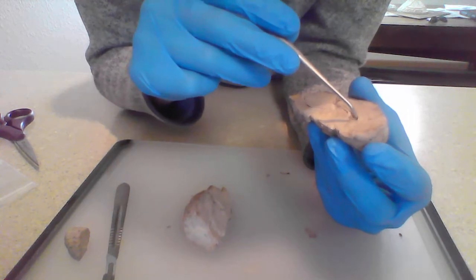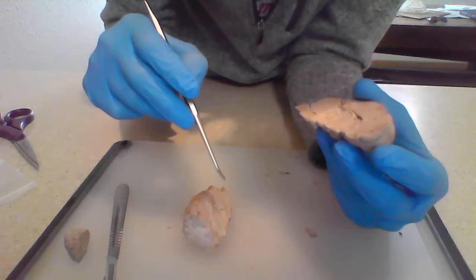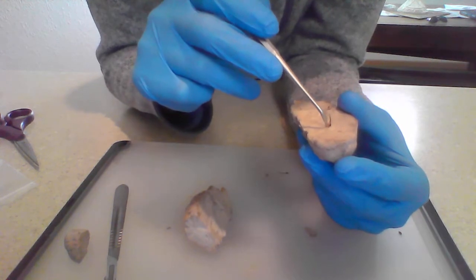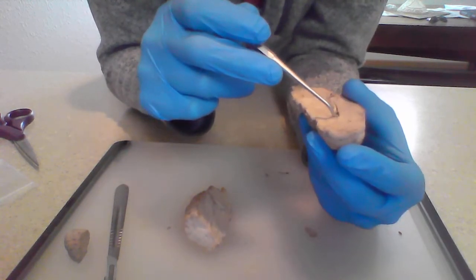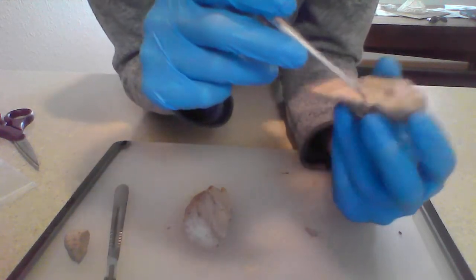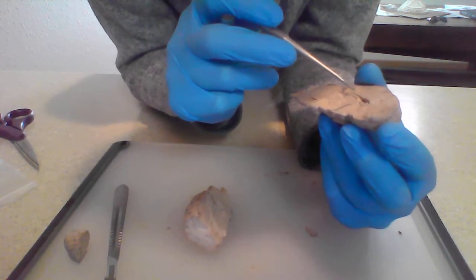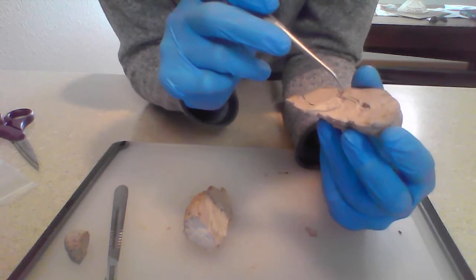Here we have the lateral ventricles, 1 and 2, but together they're just called the lateral ventricles. I tried cleaning out the septum lucidum as much as I could, but I didn't want to damage any of the internal structure there. So as a result, it doesn't look exactly like it does in the pictures, but I did the best I could. And up top, I believe, of all the ventricles, is what is called the choroid plexus, which is responsible for making cerebral spinal fluid.